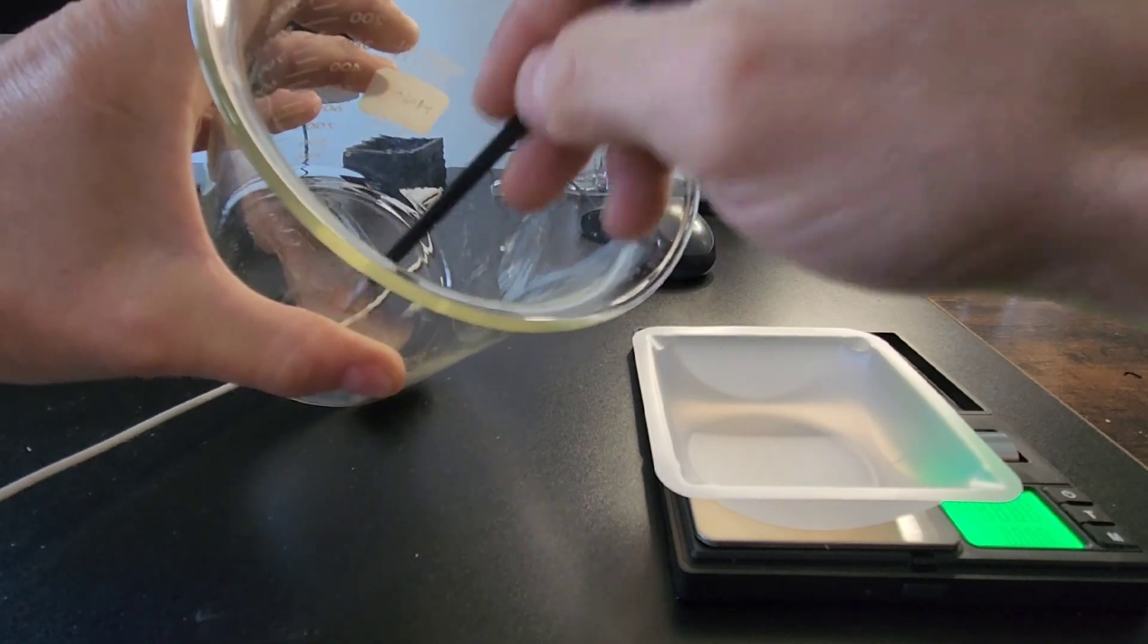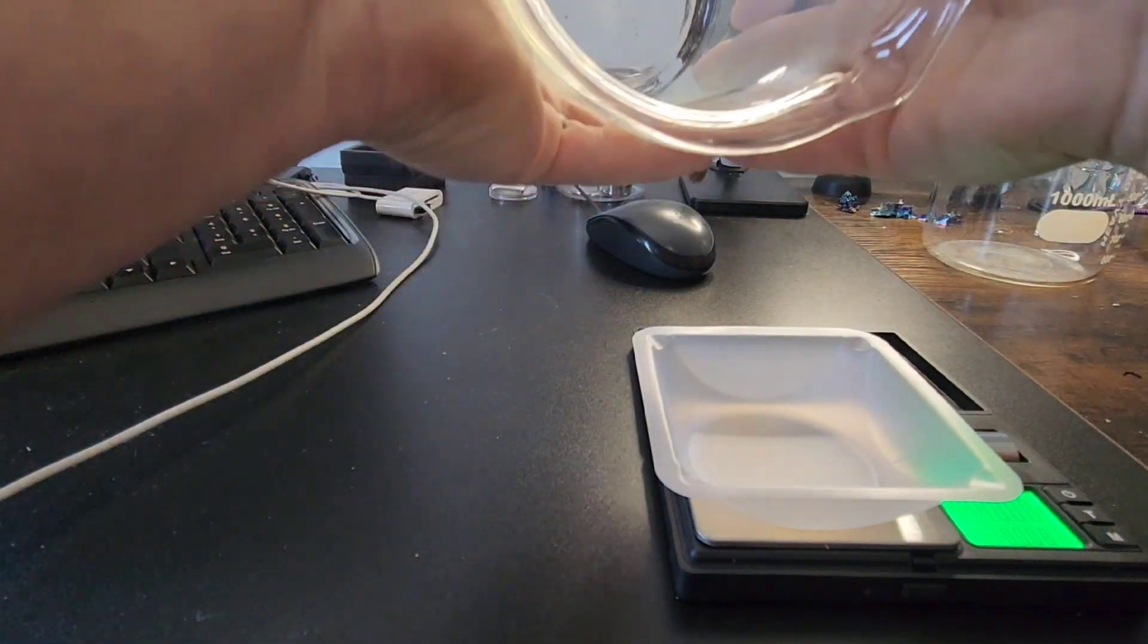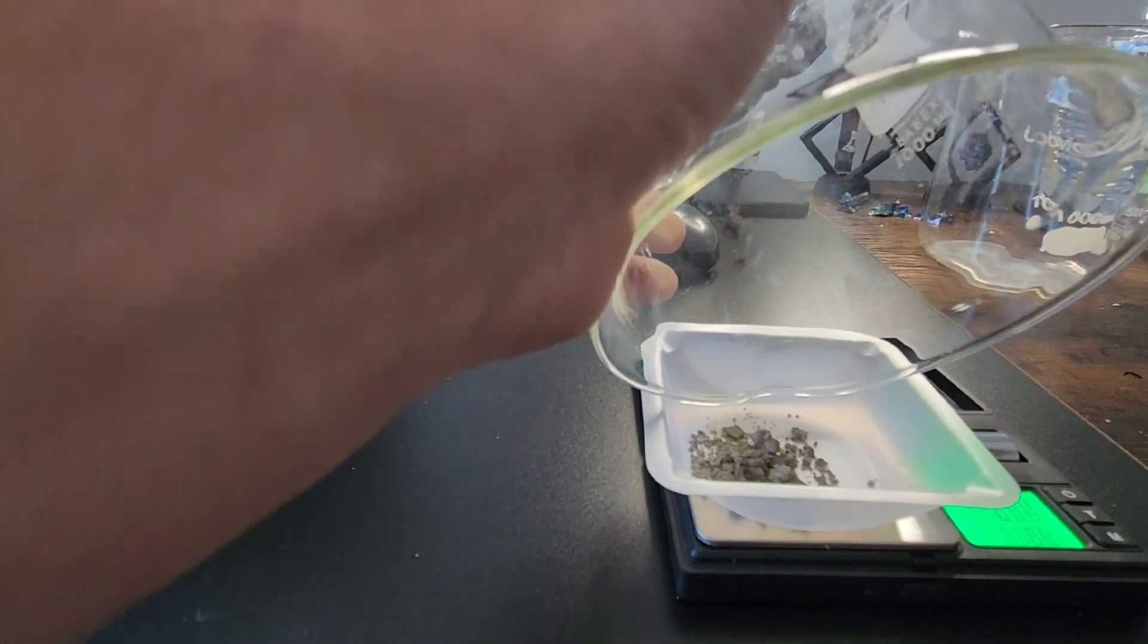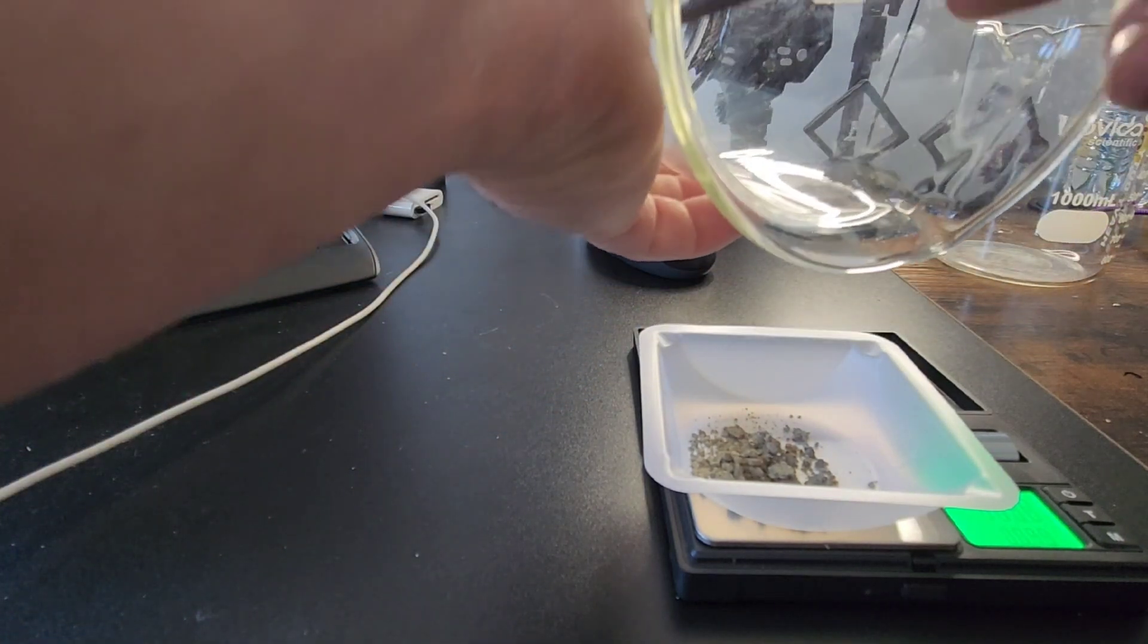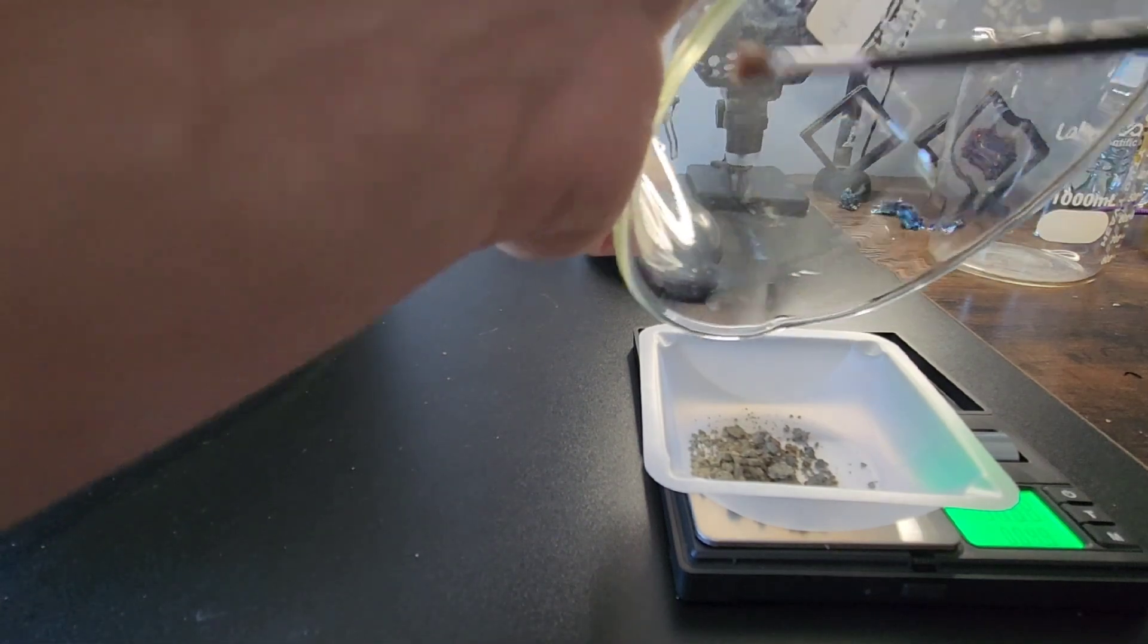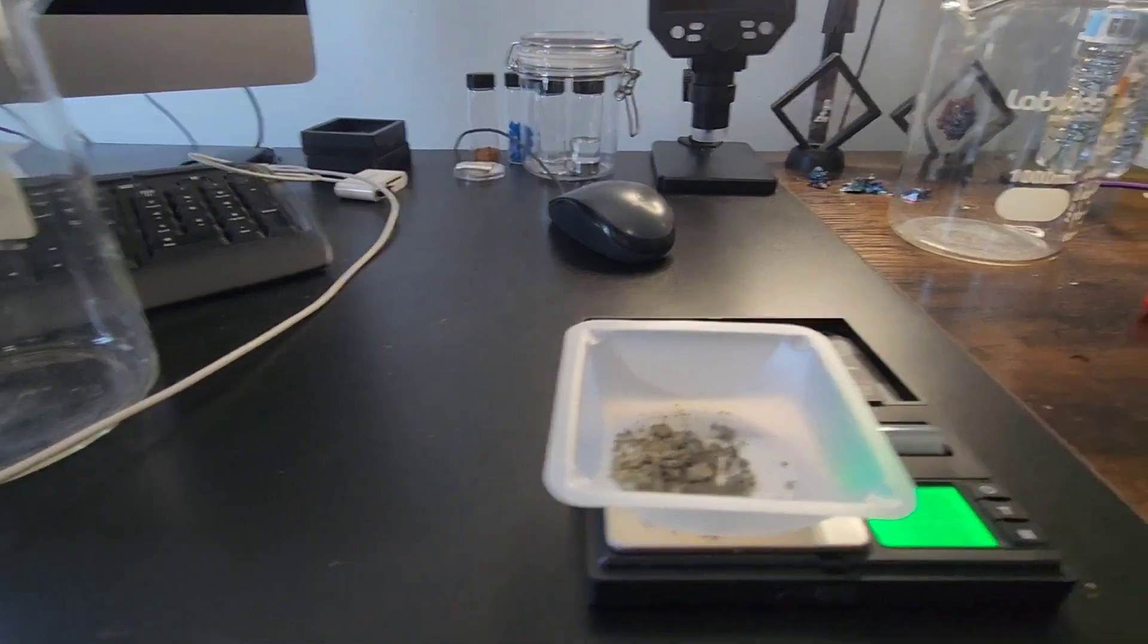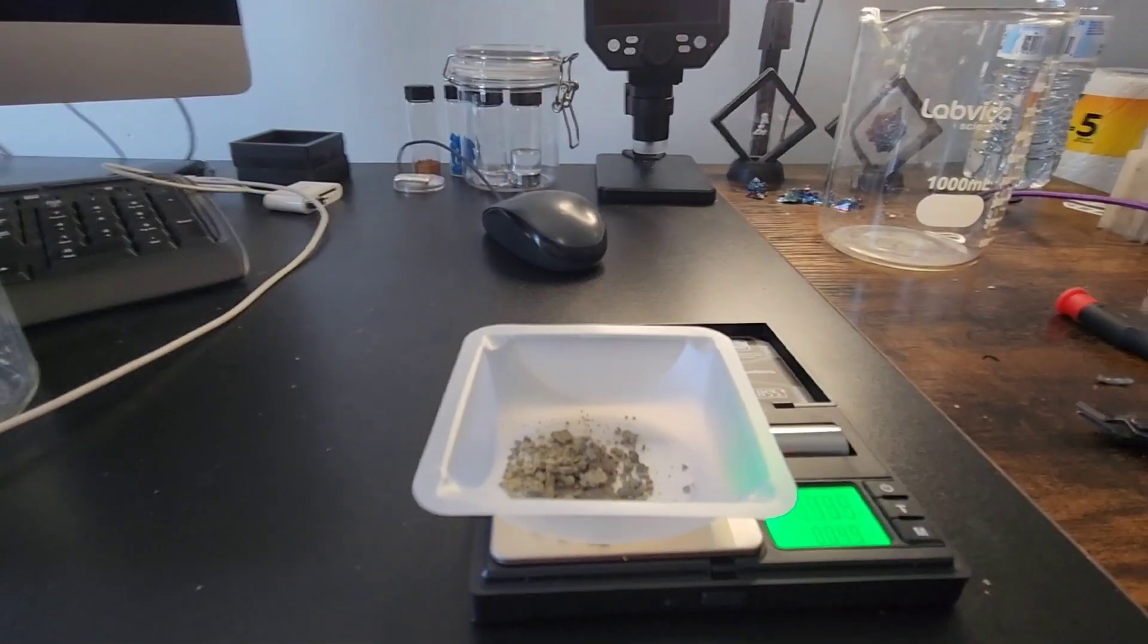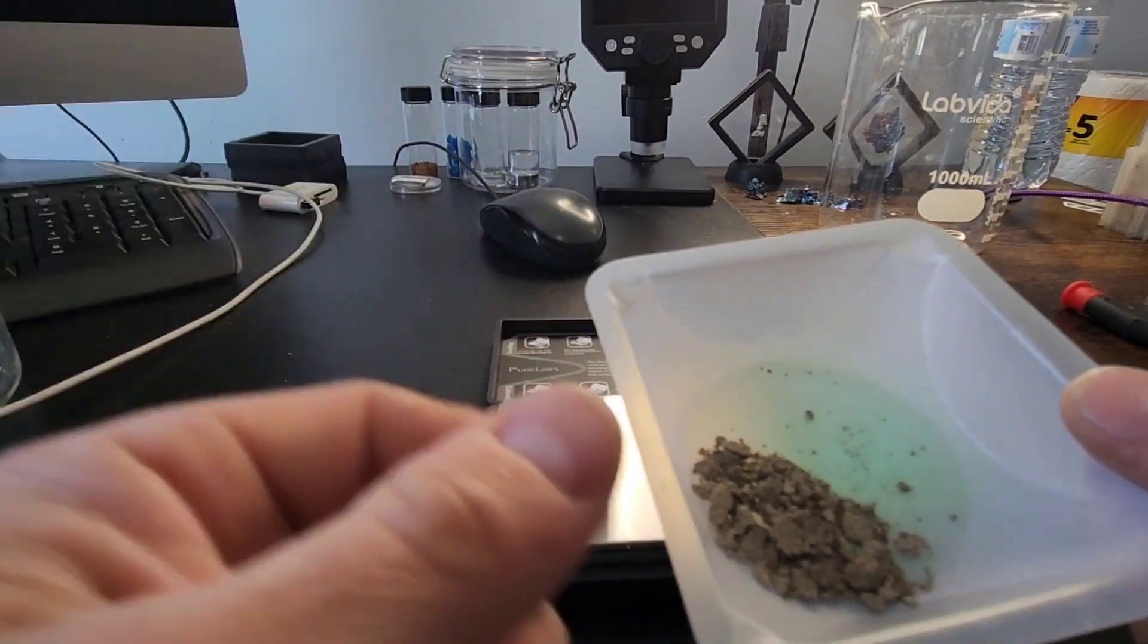So I think it is safe to say we got 1.39 grams of silver out of there. But it works really nice, that aluminum method. I like that a lot.